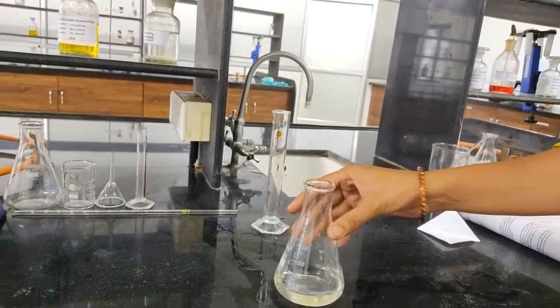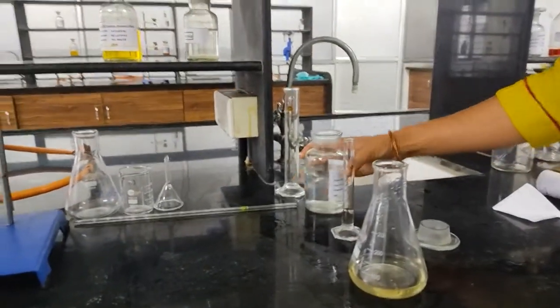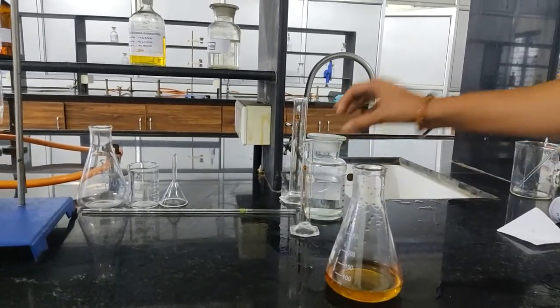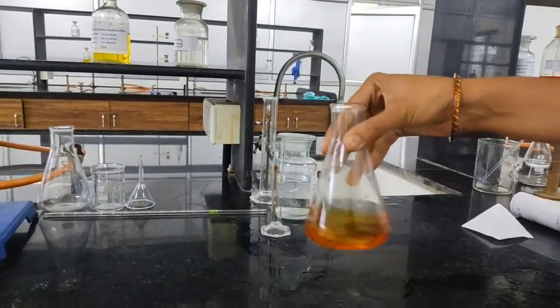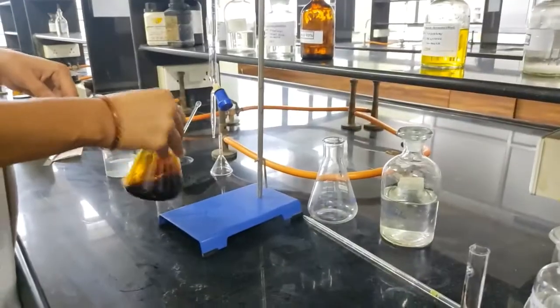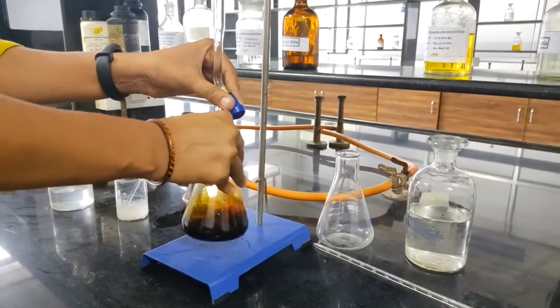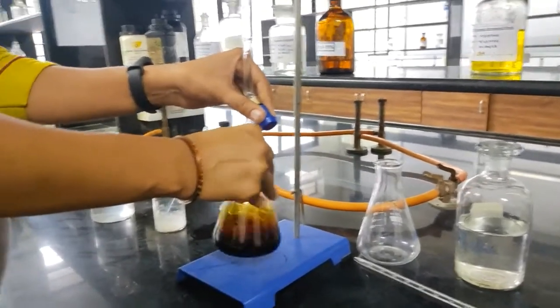Now add 3 ml of 2 molar HCl to this solution. Then titrate against 0.1 molar sodium thiosulfate solution using starch as an indicator. The titrant is 0.1 molar sodium thiosulfate solution. Add starch solution as indicator towards the endpoint to get a proper endpoint.